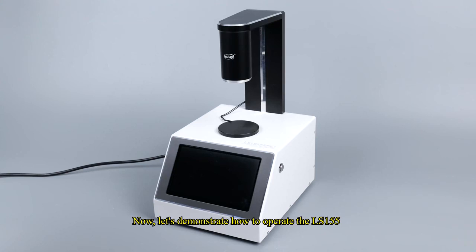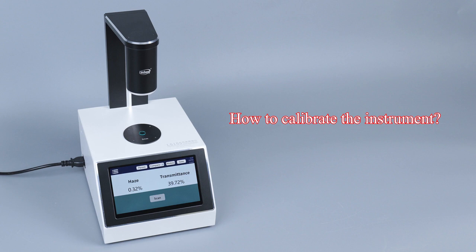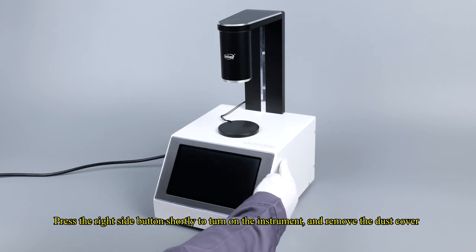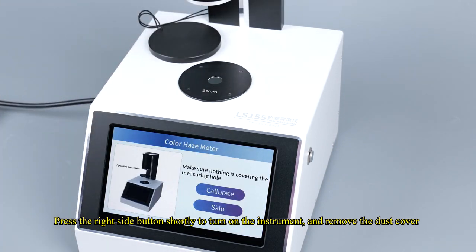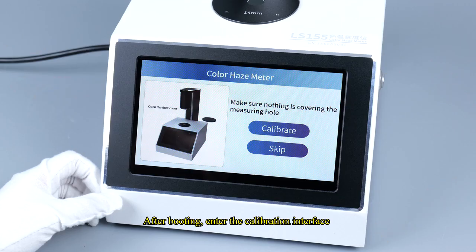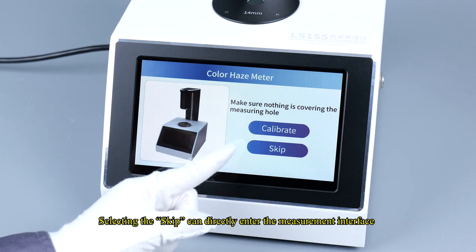Now, let's demonstrate how to operate the LS155. How to calibrate the instrument? Press the right side button shortly to turn on the instrument, and remove the dust cover. After booting, enter the calibration interface. Selecting Skip can directly enter the measurement interface.